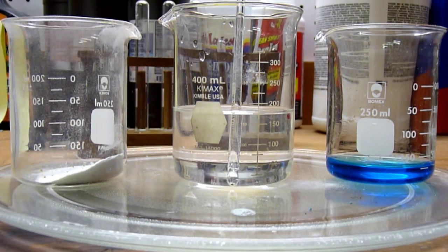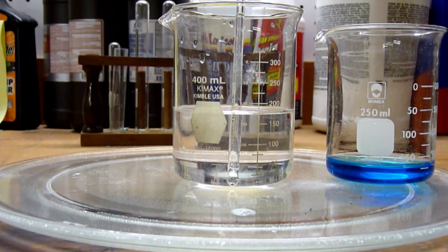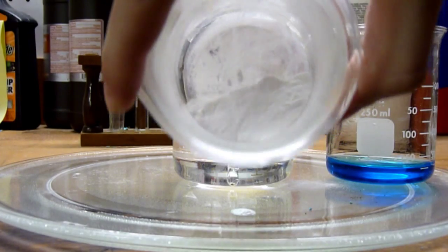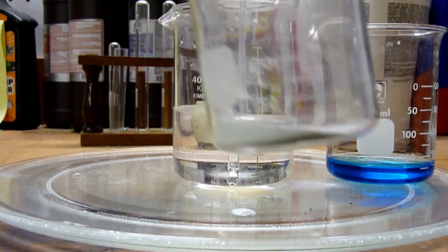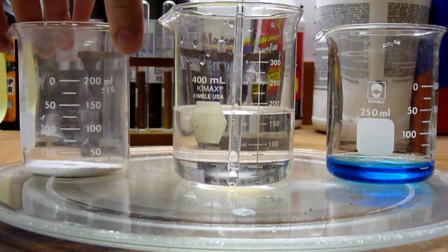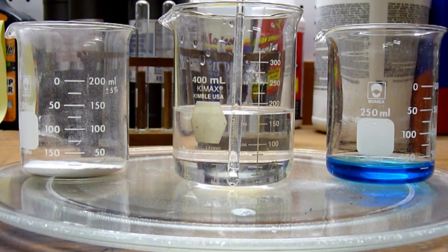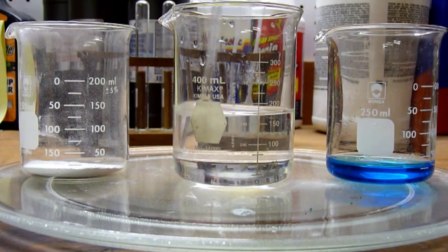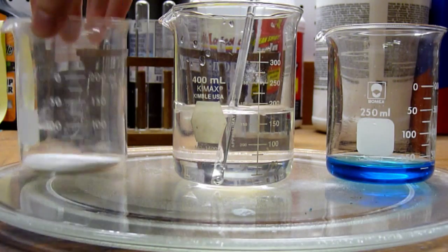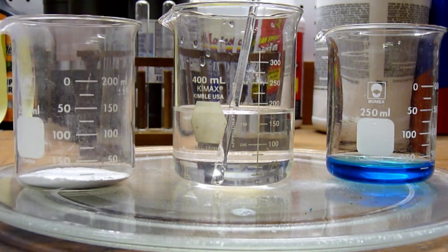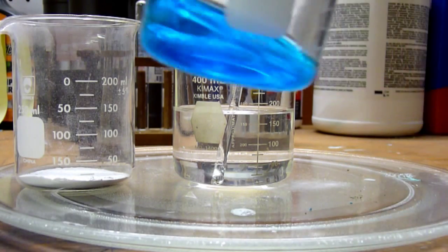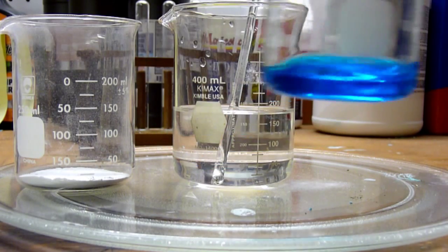Okay, so our sodium carbonate, or our sodium hydrogen carbonate, has been fully decomposed into sodium carbonate. And this is the carbonate right here, just a fine white powder. And though not very soluble in water, it is soluble. And here is a solution of sodium carbonate. Also over here is a solution of copper 2 sulfate, which I prepared earlier.